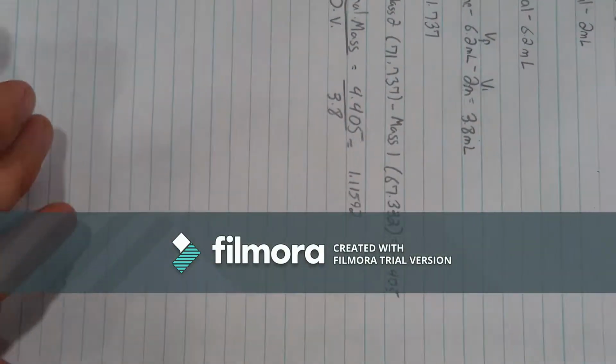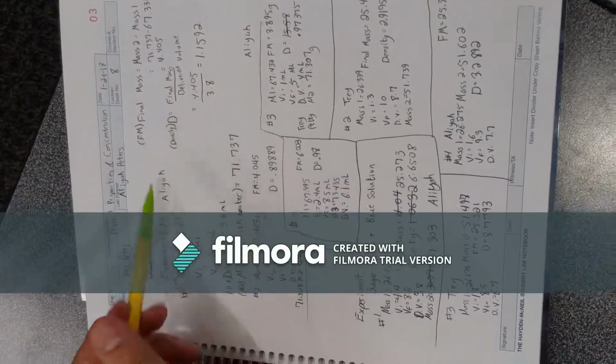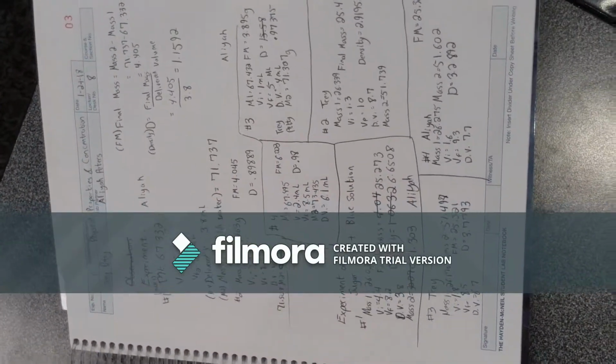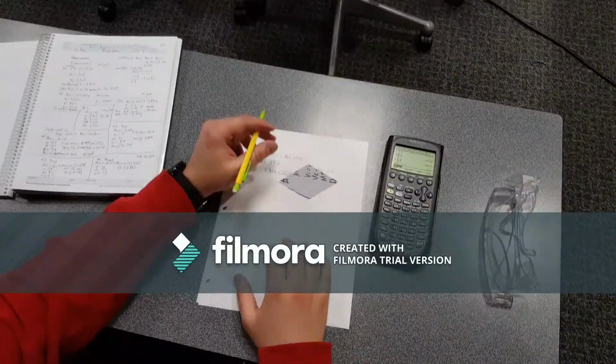And then over here, you'll see that we actually did this 4 times total. There's 1, 2, 3 and 4, and we did it again with the sugar solution, blue solution, and then I will proceed to show you how we found the concentration of an unknown.